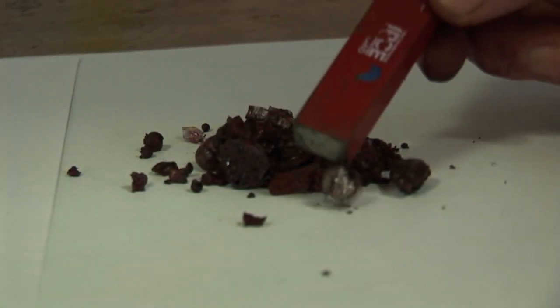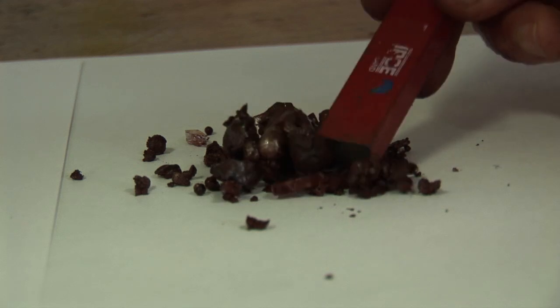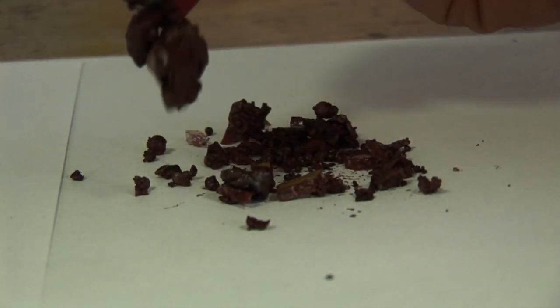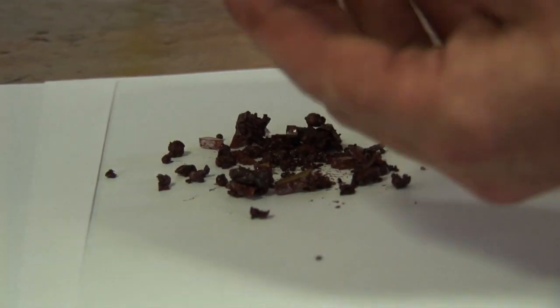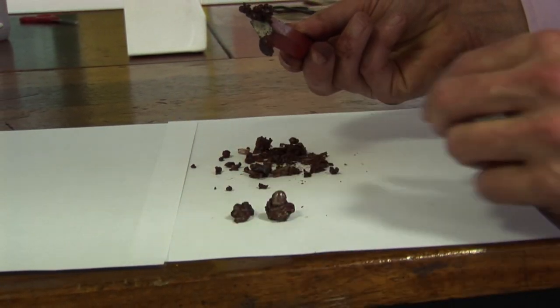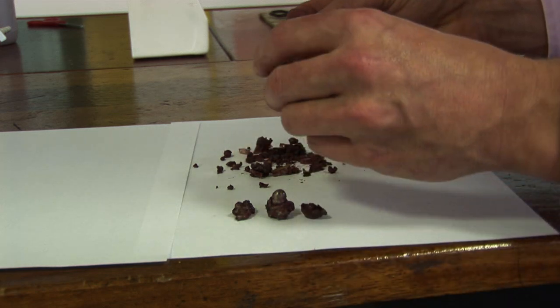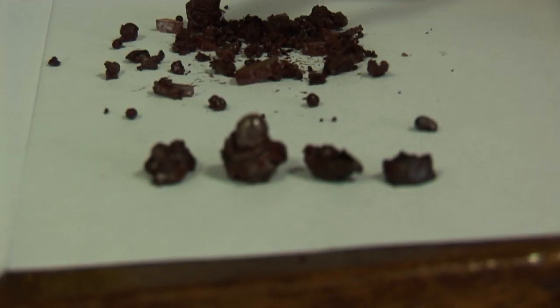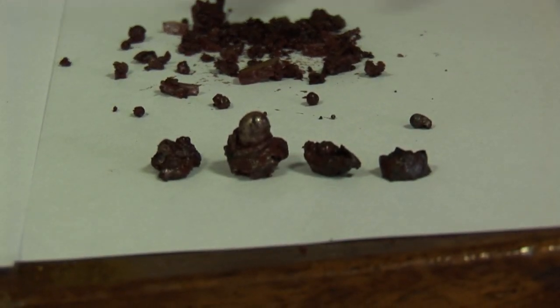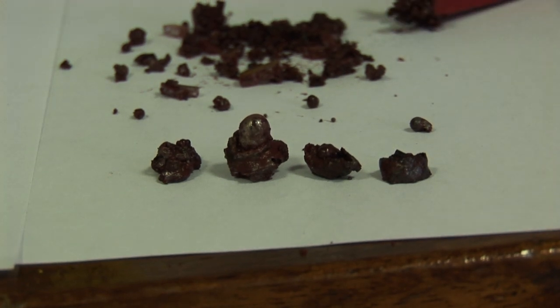There's still some unreacted iron oxide, but if we use a magnet you can see we're picking up lots of particles sticking to the magnet. You can quite clearly see some of these that look like molten blobs of iron — droplets of iron that have cooled on landing in the water. Rust back into iron, thanks to the reactivity of aluminium powder. Classic displacement reaction.